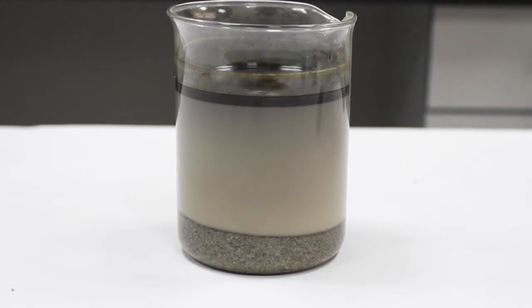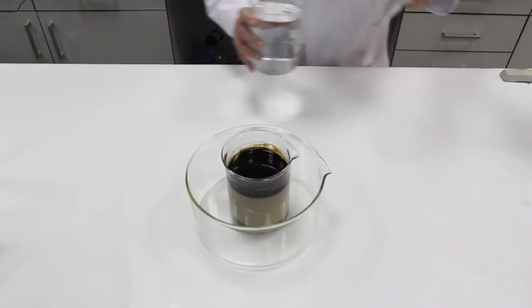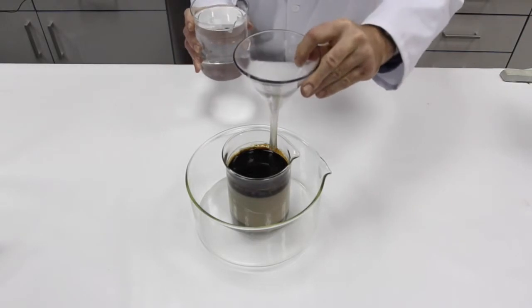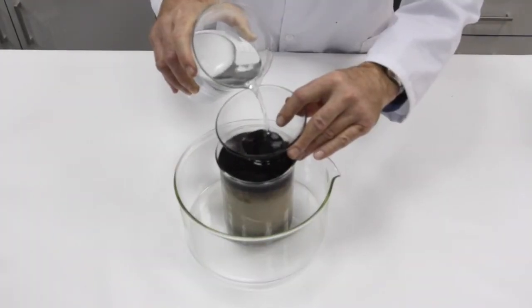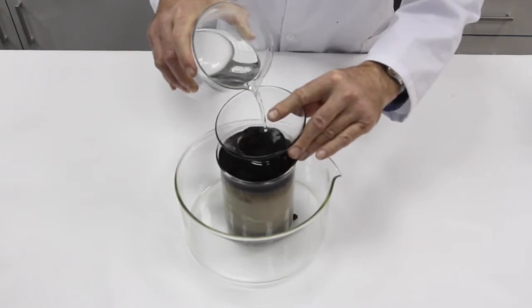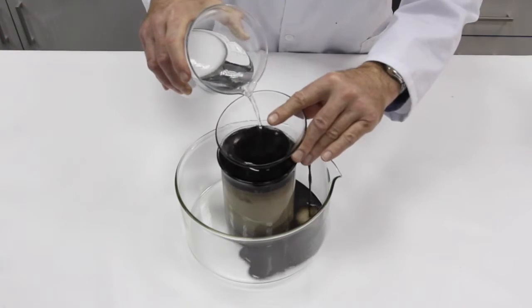If left resting longer, you could see how the emulsion changes color, leaving the lower part lighter and the upper part darker. This occurs because the crude oil rises to the surface. The liquid surface is completely covered by the crude oil that detached and separated from the remaining liquid, allowing to extract it from the liquid mass for its later recovery. We can see that the beaker's walls are clean and free of the crude oil.